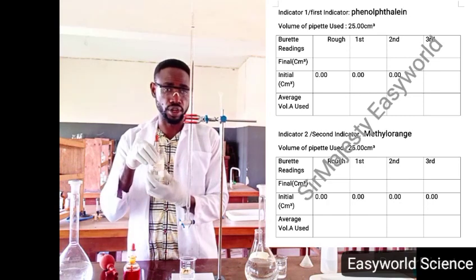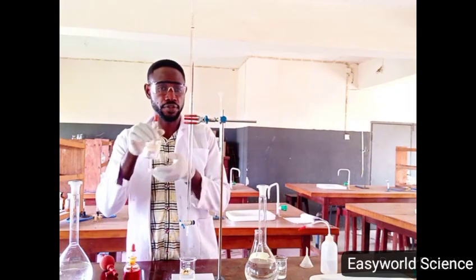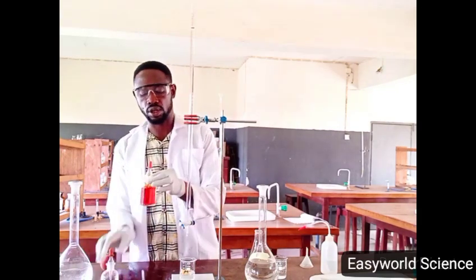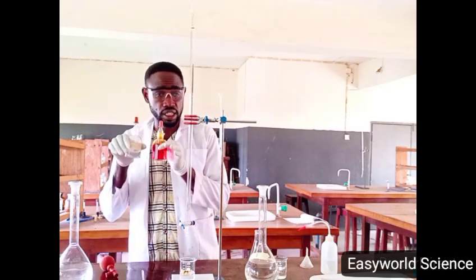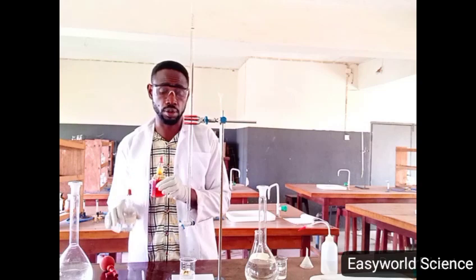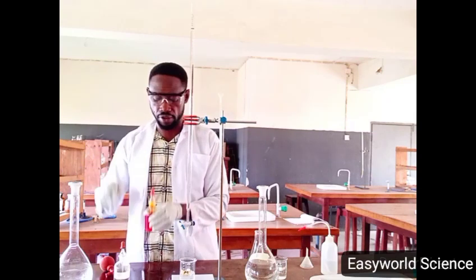If you are using phenolphthalein, the equation of the reaction will just be HCl plus Na2CO3 to give you the acid salt, sodium bicarbonate, because the endpoint there will just form sodium bicarbonate. But on complete neutralization, methyl orange will ensure complete neutralization. If they ask you the most suitable indicator in the titration between hydrochloric acid and the mixture of sodium carbonate and sodium hydrogen carbonate, the suitable indicator is methyl orange, because if you use methyl orange, you get the actual endpoint straight without stopping at halfway.